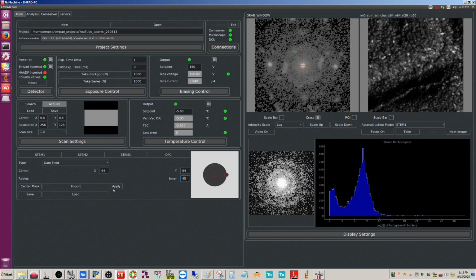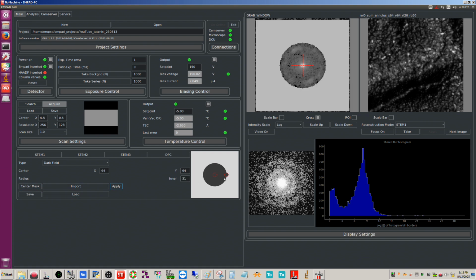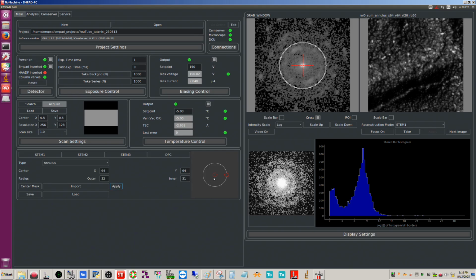No? Interesting. Okay, not sure what that's all about. Can I move this around? I can. Hit apply. Oh, it's interesting. I didn't know it wouldn't do that. So that's what it's calling dark field as opposed to annular. Okay, so you can see that's a 1 pixel radius now. But yeah, you can make this really skinny. If you're trying to isolate a specific d-spacing, you can do that here, if you know the radius that this corresponds to in your DP.